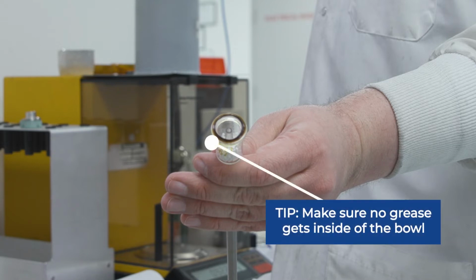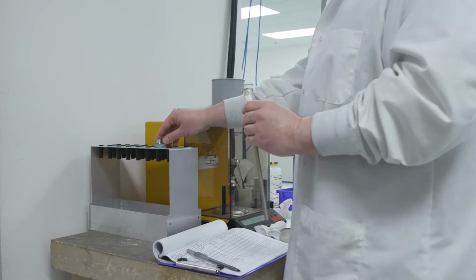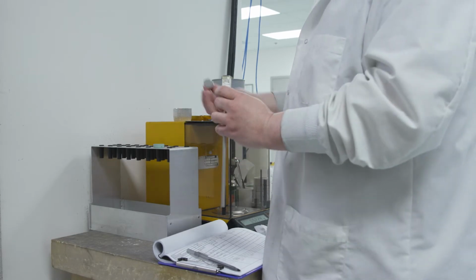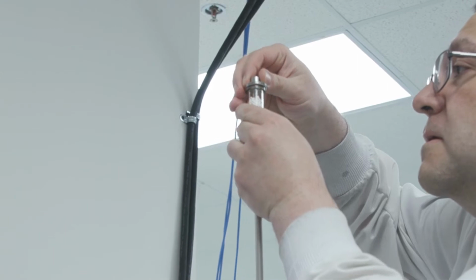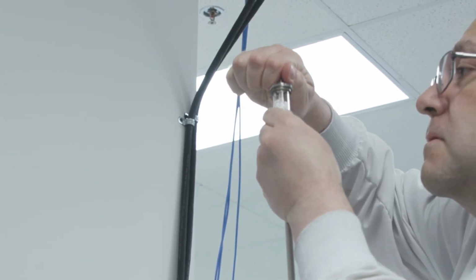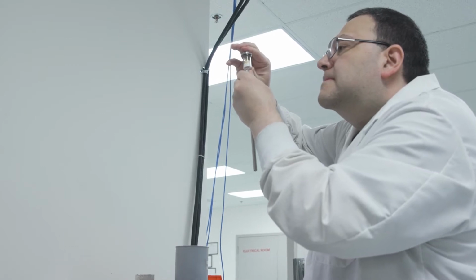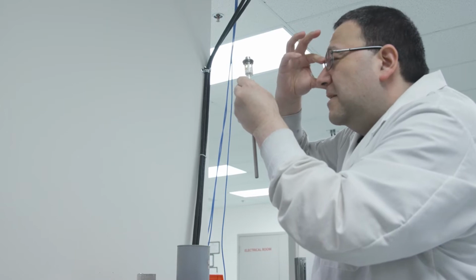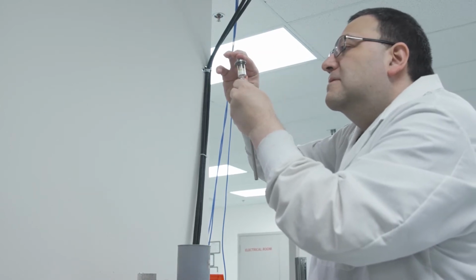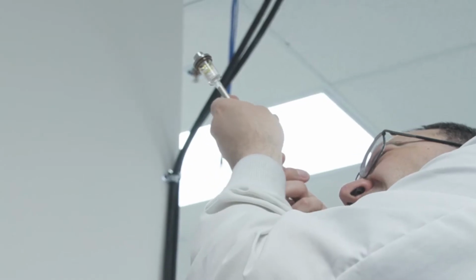We do not want any grease on the inside of the bowl, as this can get onto the sample, blocking some pores. He places the cap onto the top of the penetrometer and rotates it to spread the grease into a uniform layer around the outer edge of the penetrometer sealing surface. He wants to make sure he has the cap centered on top of the penetrometer and evenly seated on the layer of grease. It is important that the grease is uniformly distributed under the cap and that there are no air bubbles present in the film of grease that could be points where the seal could leak.